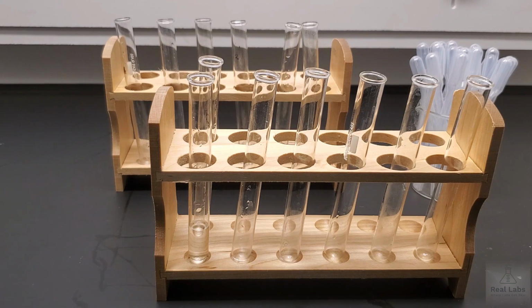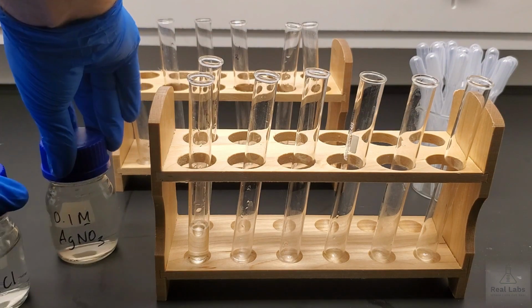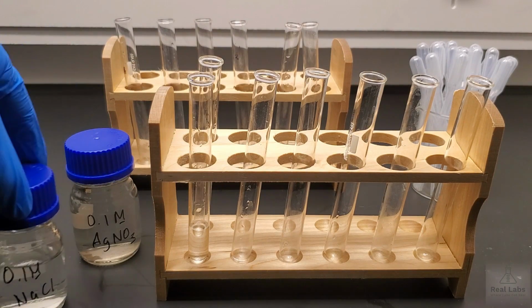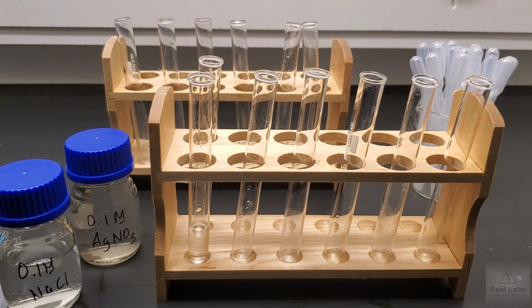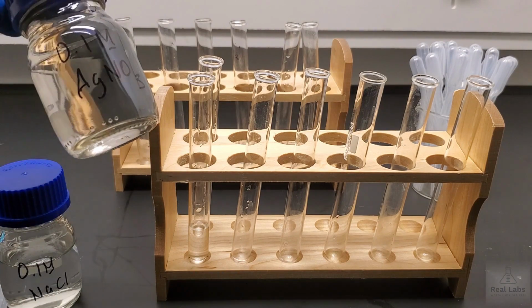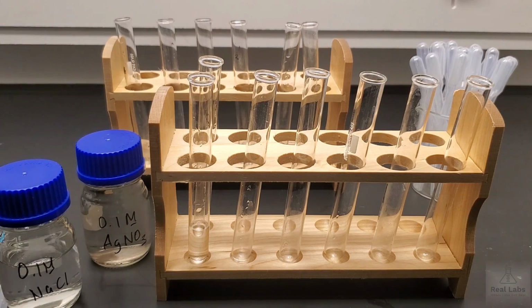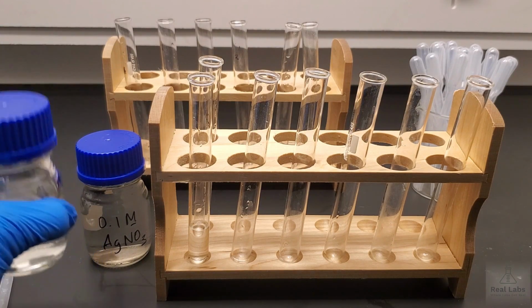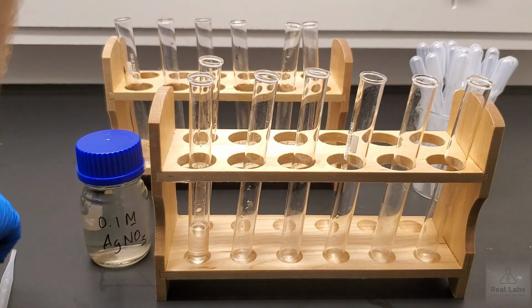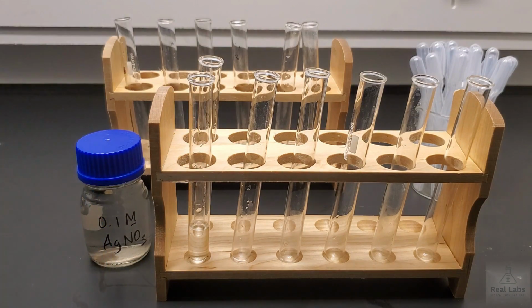The next system we're going to do is we're going to look at sodium chloride and silver nitrate. So we'll bring the sodium chloride back and we'll bring also silver nitrate into shot. So you should be careful with silver nitrate. Silver nitrate is toxic, but beyond that, if you got this on your skin, it would actually turn it black. You get these like black spots or black dots where the silver nitrate hits. So you have to be very careful with that. Even when you've got gloves on, if you've got open arms like I have right now, then you should just be careful not to splash it everywhere.